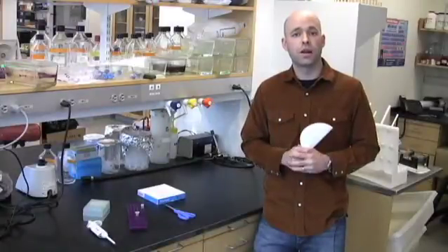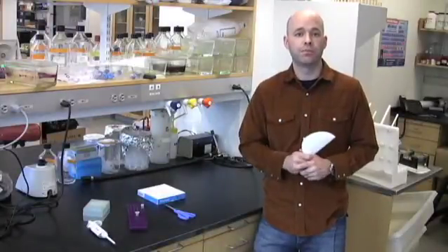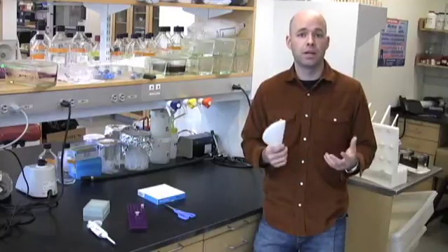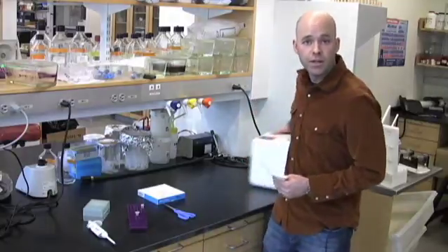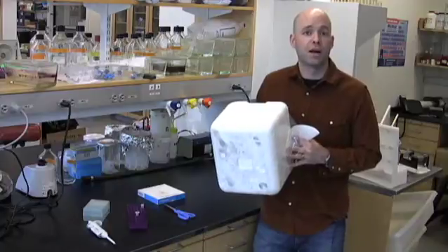So next time you have to send some DNA to a collaborator, give some filter paper a shot. It's going to save you a lot of time, a lot of money, and that painful hunt for the right size styrofoam box.